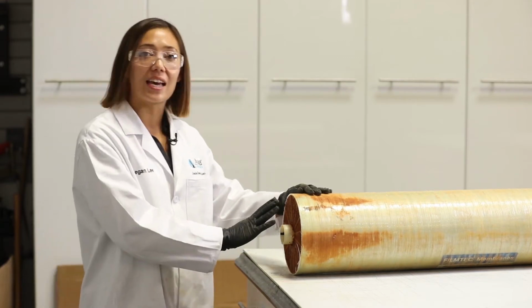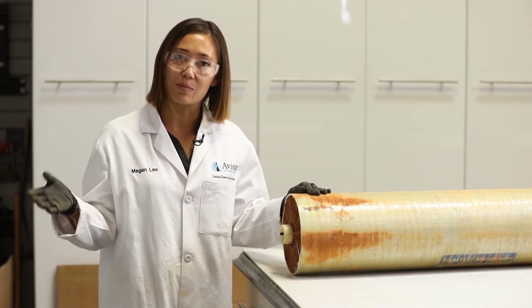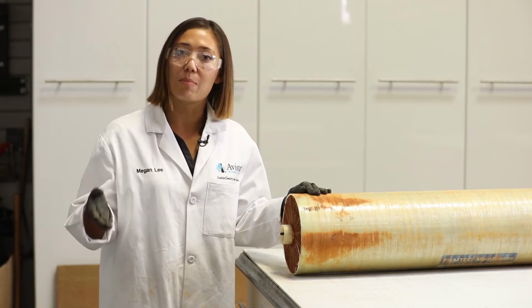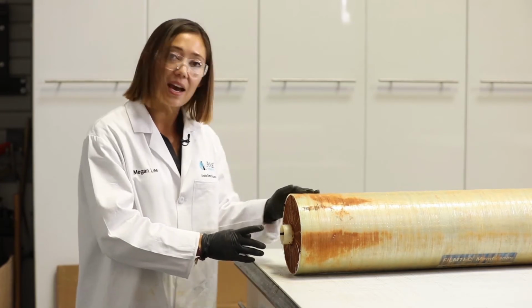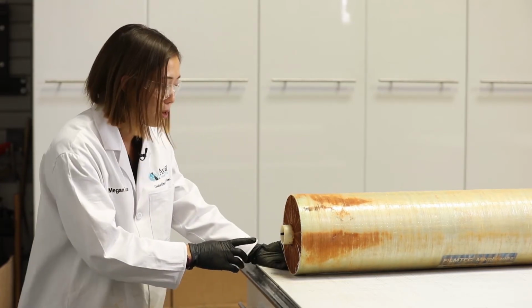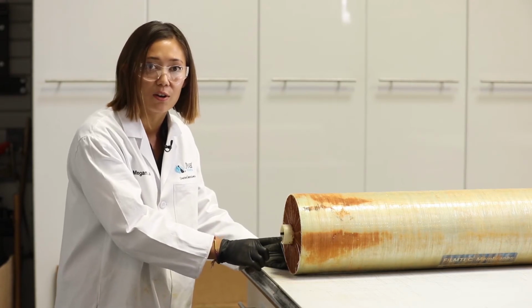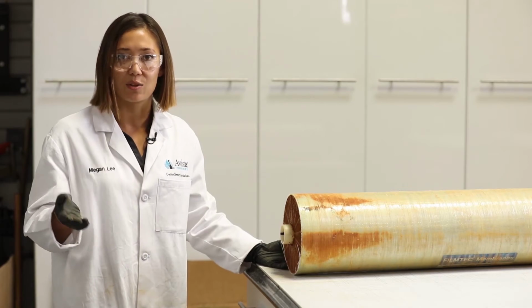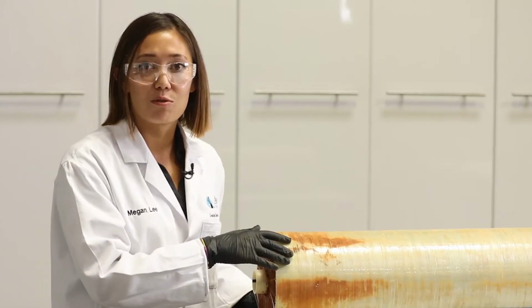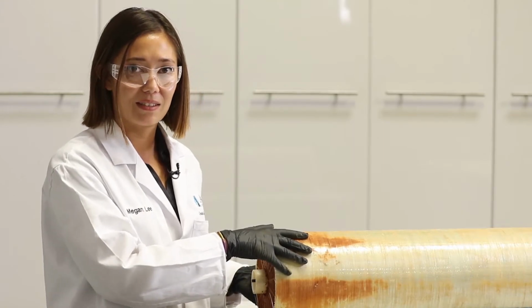If there is excessive foulant material on the scroll ends, it can create those high DPs that we see during wet testing by blocking the channels where water is supposed to flow through. An inspection of this scroll end reveals the presence of a thick layer of orange-colored foulant material, which is blocking some of that flow and creating the DP that we're seeing during the wet test. Now it's time for us to remove the fiberglass casing and look at the membrane surfaces.